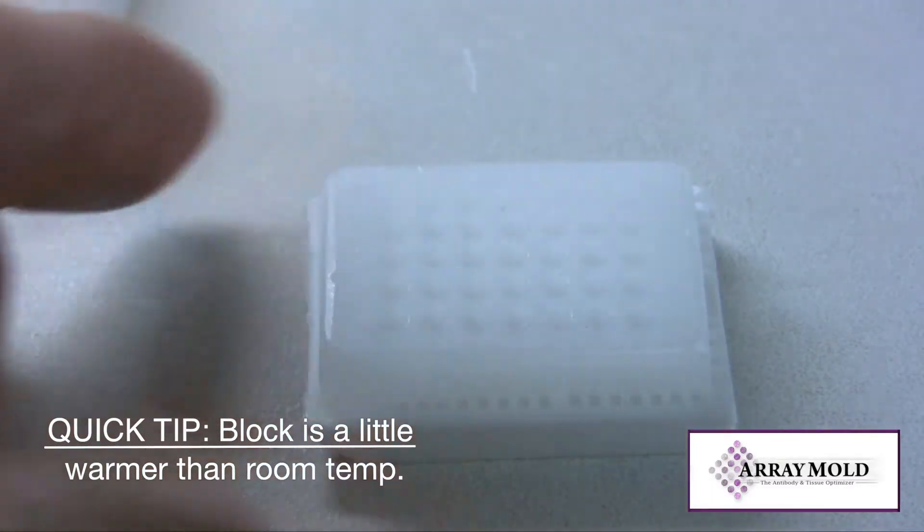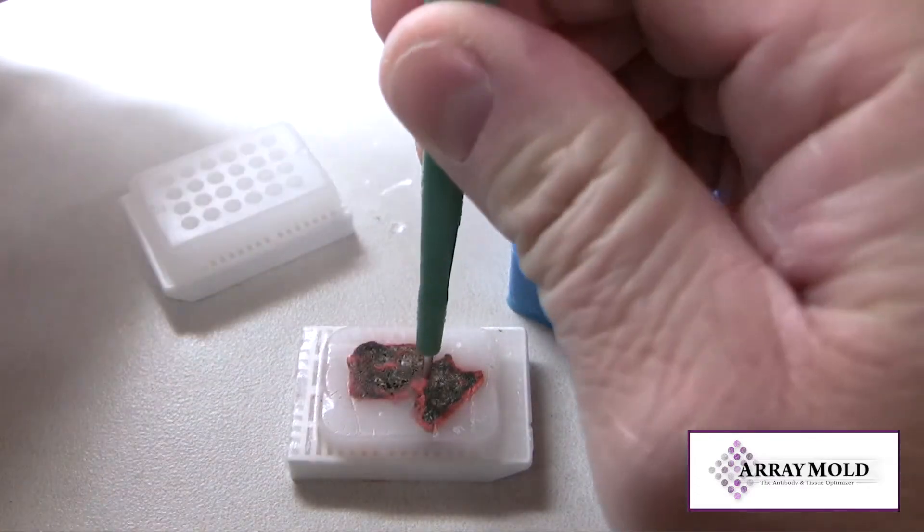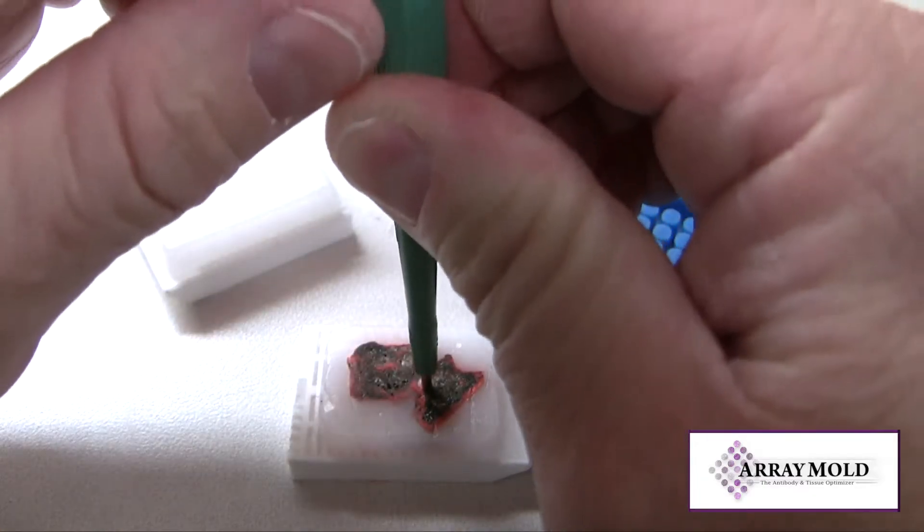Be very careful because this is where you could crack the block. I keep my TMA blocks at room temperature or slightly warmer when I am constructing them.